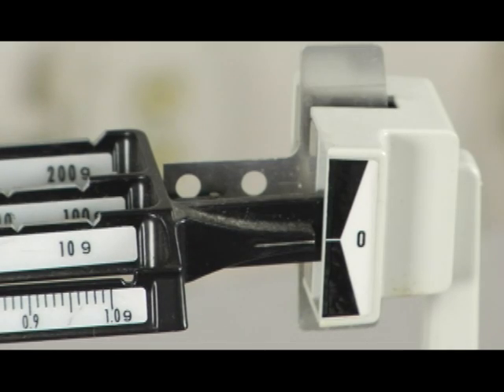Our massing of our sample, the lines here need to be directly lined up with each other.